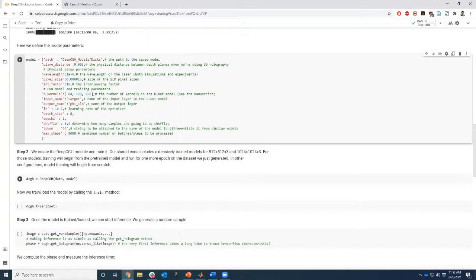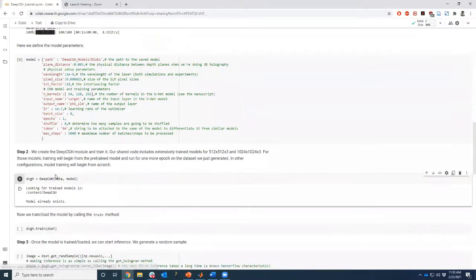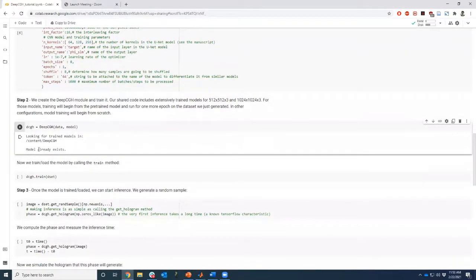So in the GitHub account, we already trained that specific model for a bunch of epochs. I think something like 100 epochs. Each epoch takes time to train. So the training part is extremely time consuming, specifically if you use large models. The beauty of it is in the operation. Once you're trained, things can go fast. But we also have saved trained models, so the algorithm spits out that the model already exists.